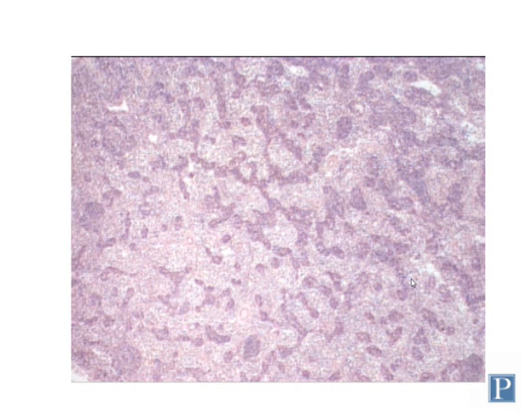Here's a higher magnification view of the medullary region or medulla of the lymph node, and so you can see that the arrangement of cells is quite different. Instead of these spherical or nodule arrangements of cells, you have these cord-like arrangements of cells. So these basophilic cords of cells are called medullary cords, and they're composed of both B lymphocytes and T lymphocytes, as well as plasma cells.